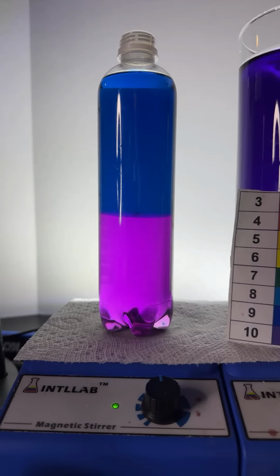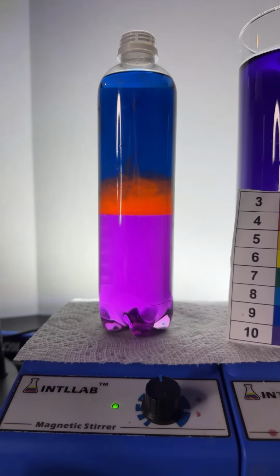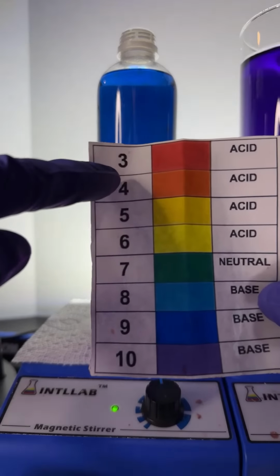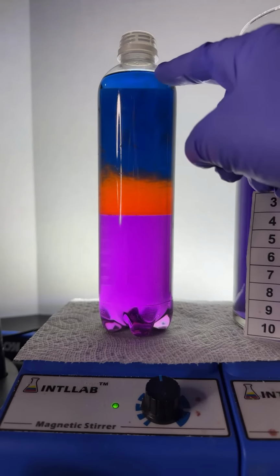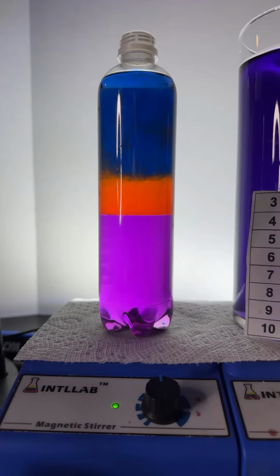Let's add some hydrochloric acid. Here we go, baby. And it goes 1, 2, 3, 4, 5, 6. Now, this is kind of cool. You can totally see that I have added hydrochloric acid, man. Come on now. Of course you know that, right? I added the acid. It's going down to pH 3. And we also know the acid is more dense than the alcohol, but less dense than the salt water. Come on, man. That's just cool.